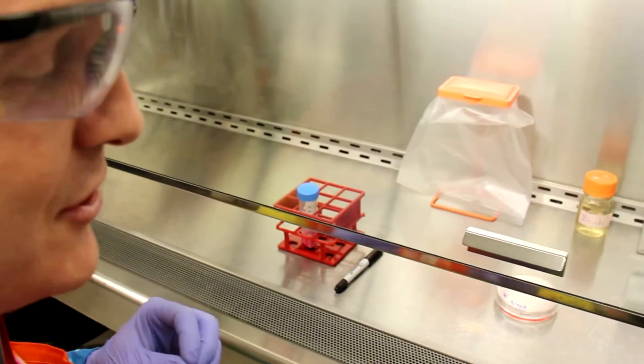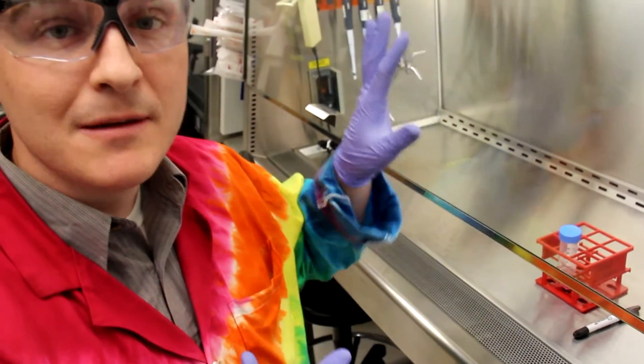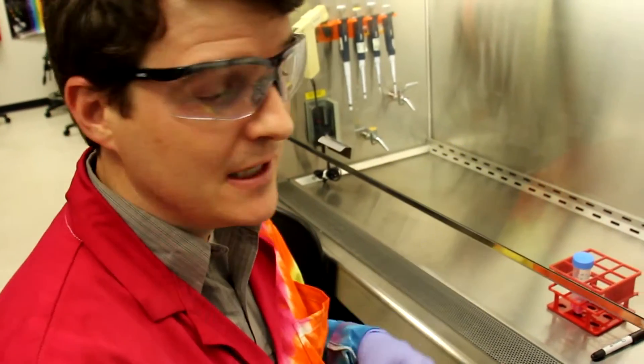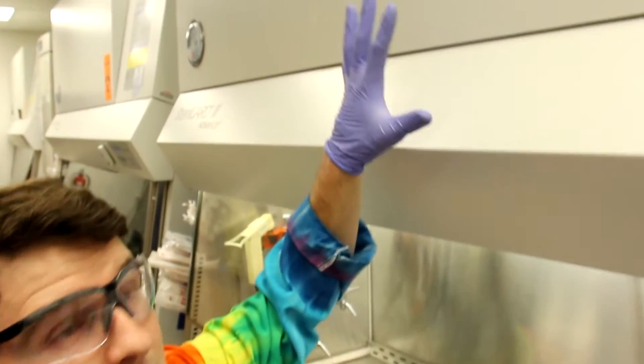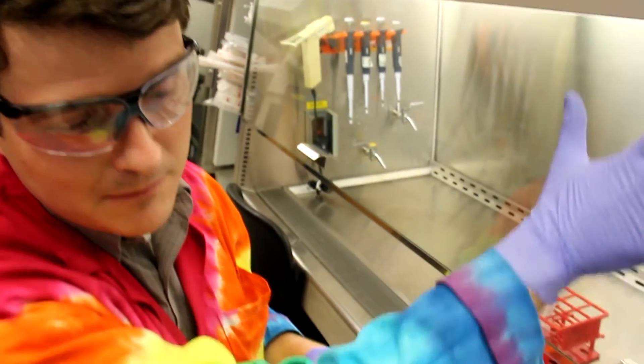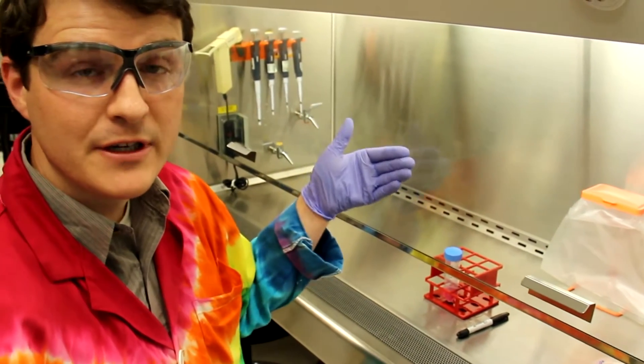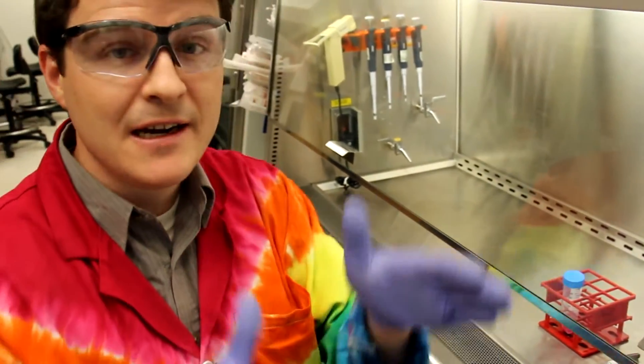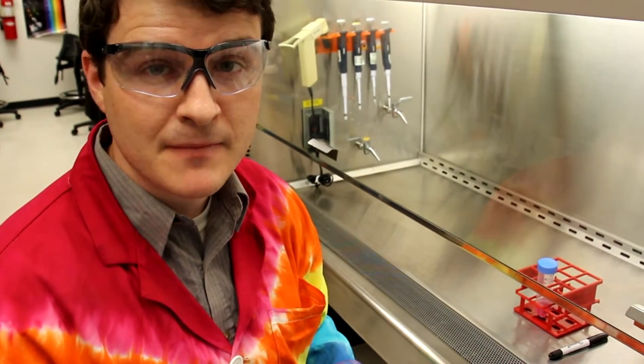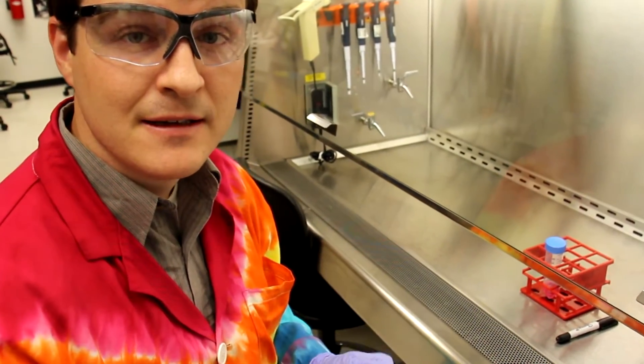As we work with our cells, we want to be conscientious that we don't move in and out of the hood too often. We're performing this work in a biosafety cabinet, and the way the biosafety cabinet functions, the way it preserves an aseptic environment, is it filters the air in the top, the air passes through a HEPA filter, and then passes that air in two sheets. One sheet or column going into a grate on the front of the hood, and a second sheet of air passing along the back wall of the hood and entering a grate in the back of the hood. Both of those sheets of air act as walls, preventing any material from floating or drifting into the sterile space within the hood. We now have those conditions present, so I'm going to walk you through changing the media on a cell culture plate in this aseptic environment.